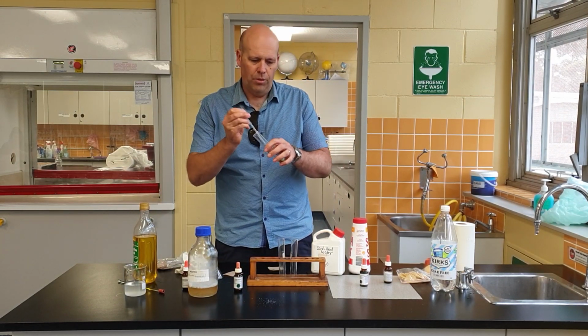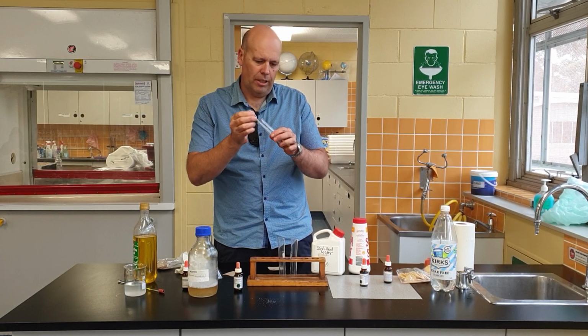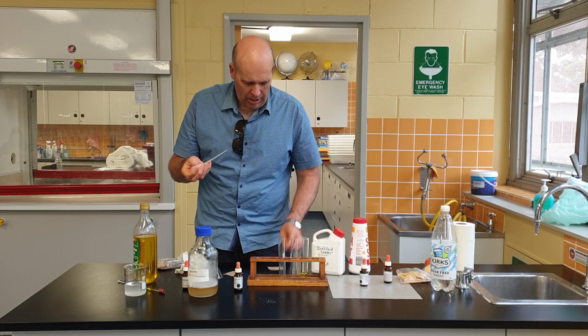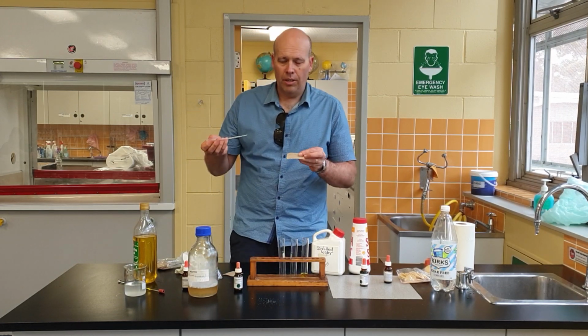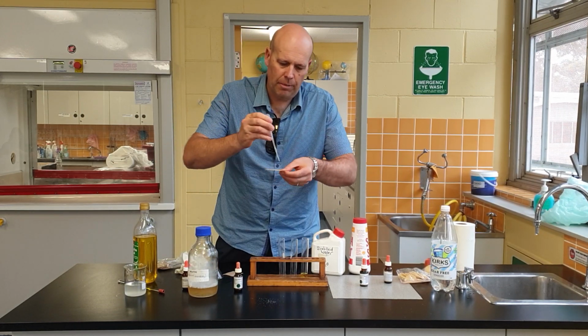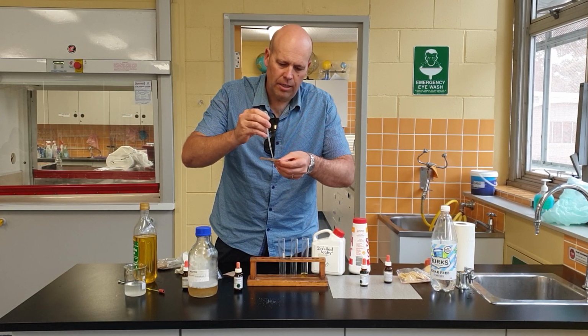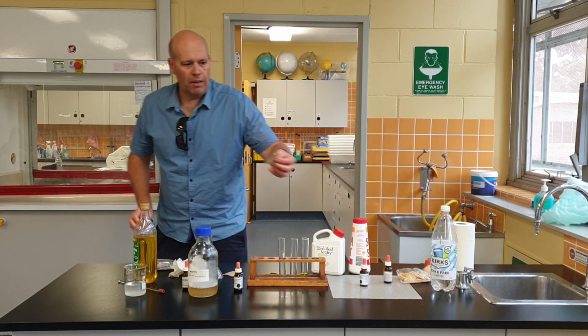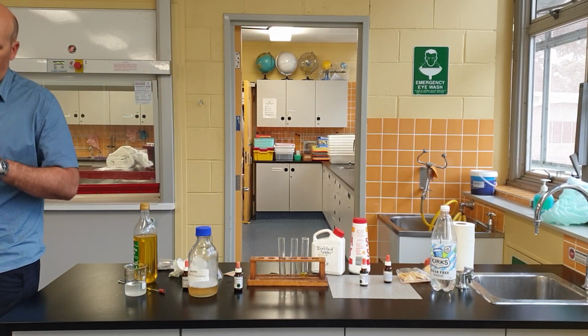And here we go. Now I'm going to put a drop of oil onto this brown paper, and I'm just going to let it sit there for a bit. And I'll bring it over and I'll show you what's going on.